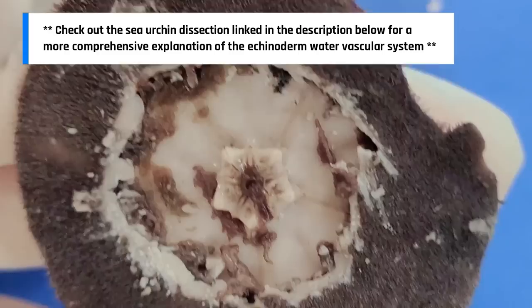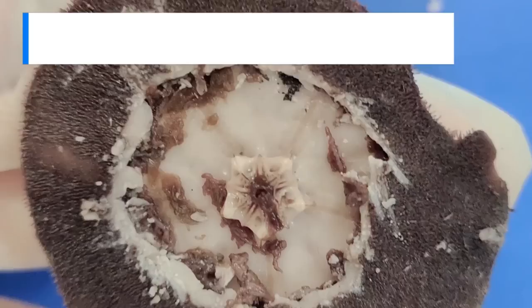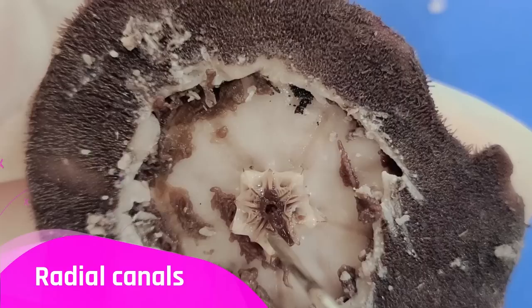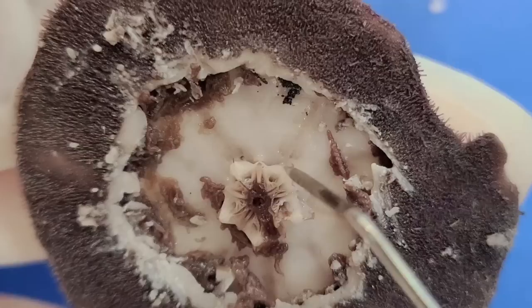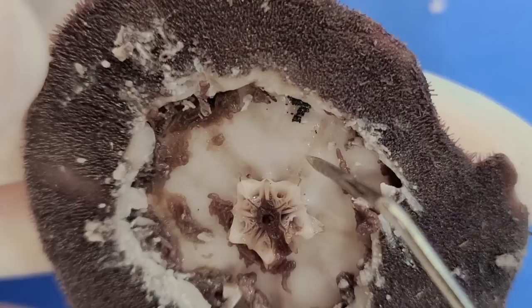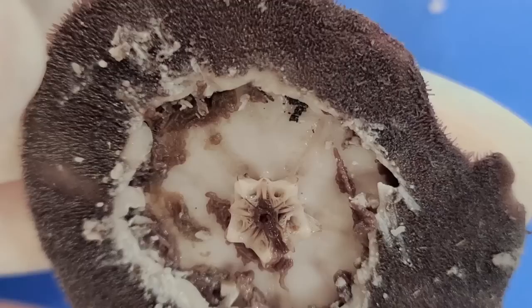The water vascular system is very difficult to see because it's really delicate and just gets destroyed when we open it, but we can see some remnants of it. Water is usually drawn into the madreporite and enters the ring canal, and from the ring canal the water goes into the five radial canals along these grooves. You can see these little raised structures along the radial canals called the ampullae, which act as valves for the tube feet connected on the other side of the test. When the ampulla contracts, water pressure causes the tube foot to extend; when it relaxes, the pressure is released and the tube foot is withdrawn.